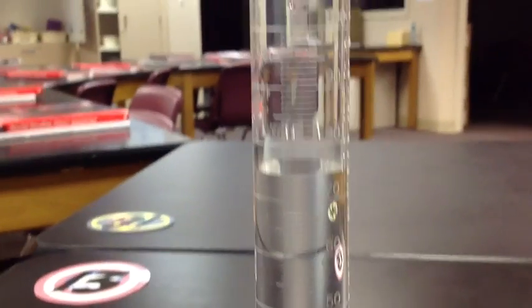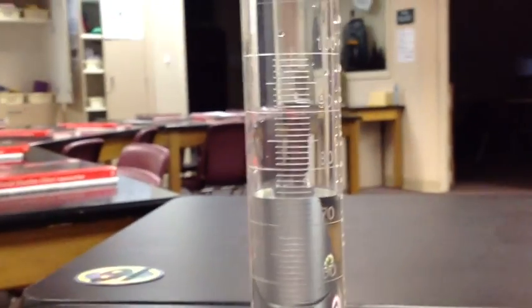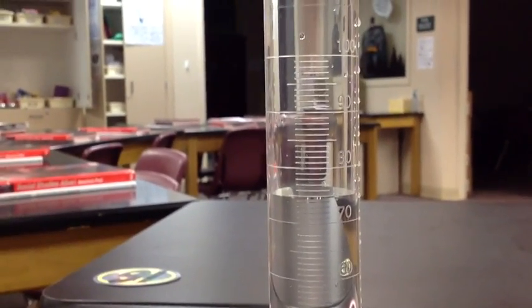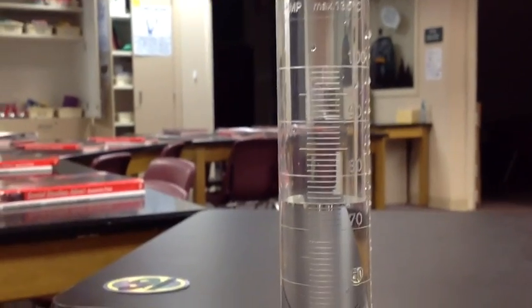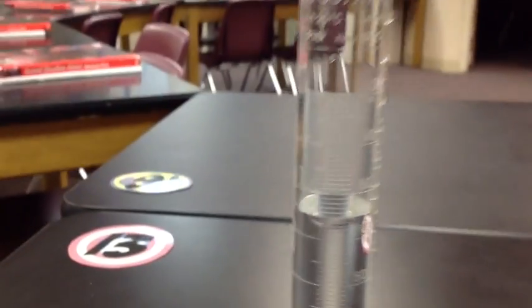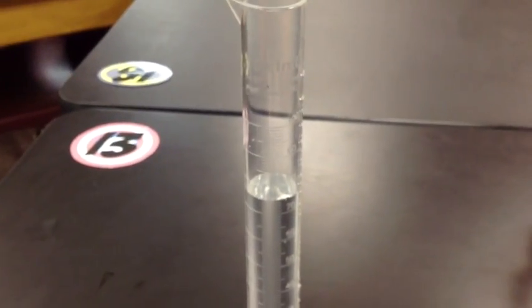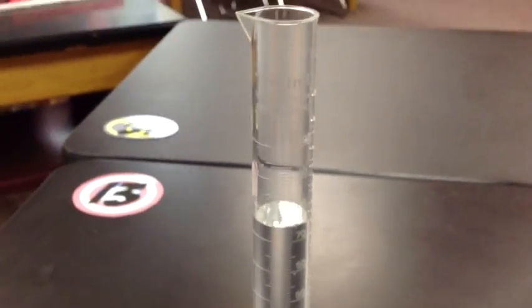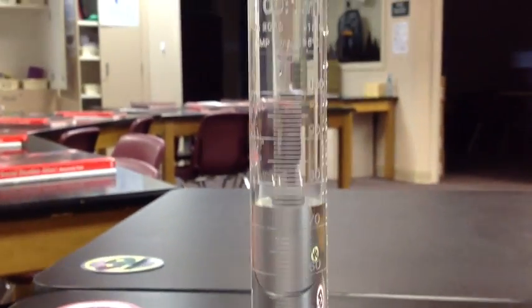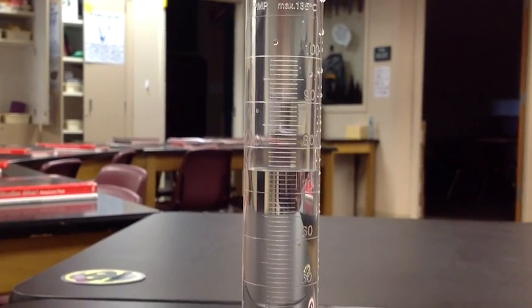Now if you'll notice, I need to start by reading how much I have in there to begin with. To do that I can't do it from up here. If I do it from up here I'm not going to get the proper reading. I have to come down and be exactly level with the level of the water.